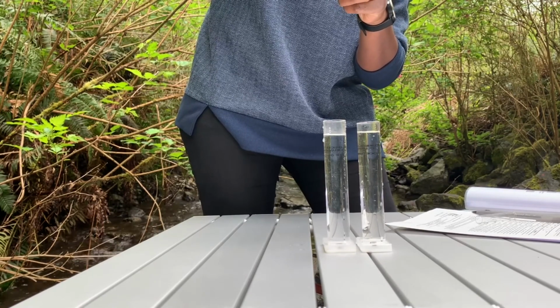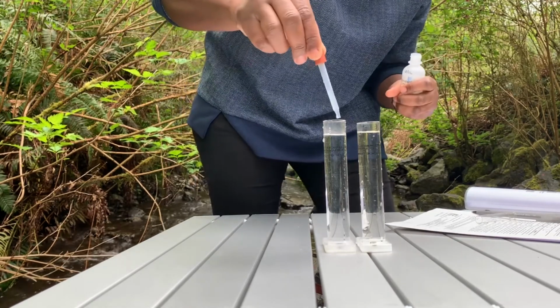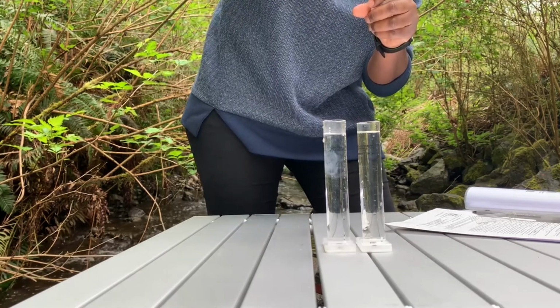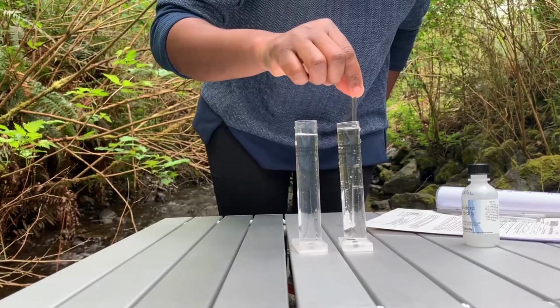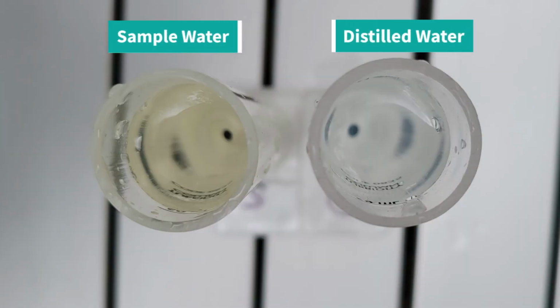Luckily for us all, our drinking water is almost always very clear. Very low turbidity, if not removed, causes of high turbidity can promote regrowth of pathogens in water leading to waterborne disease outbreaks. What do you think of our sample? Is it clear compared to distilled water?